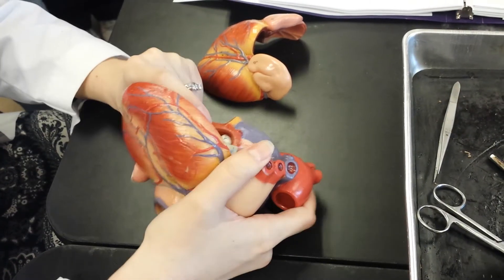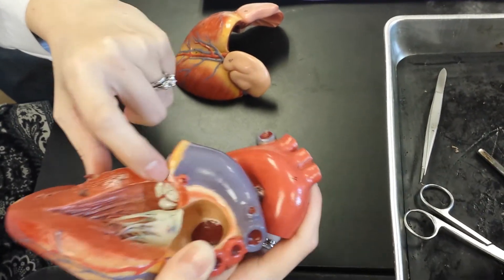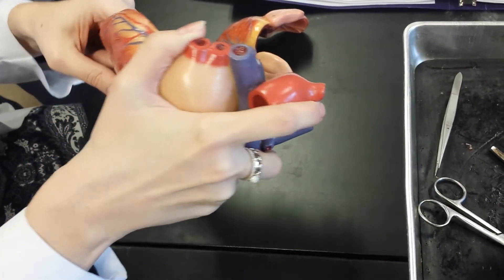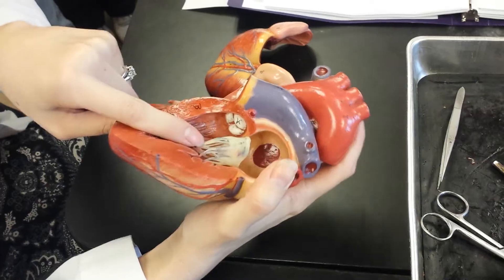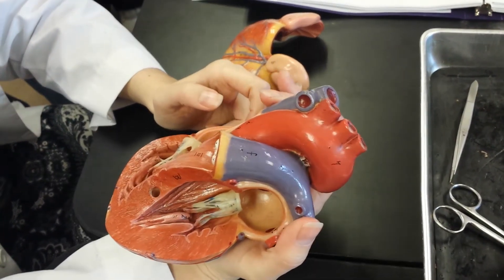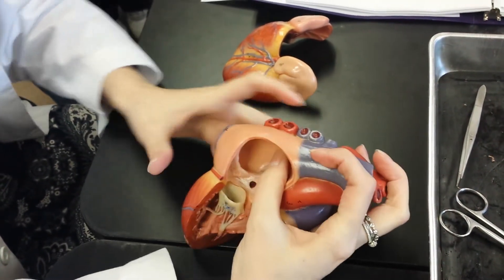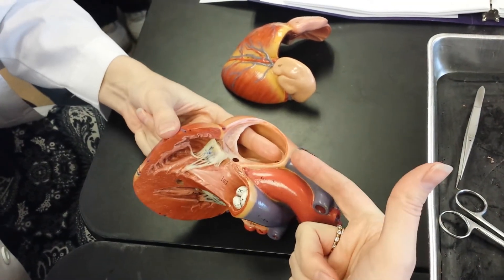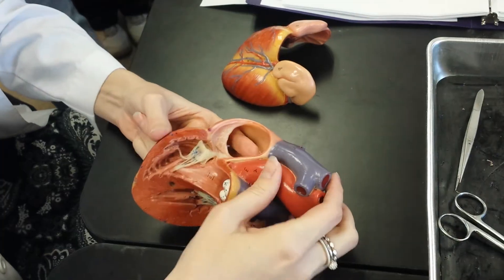And this is your aortic semilunar valve here next to my fingernail. You can also see our superior vena cava and our inferior vena cava coming in at 180 degrees in the human, and both of them dumping into the right atrium.